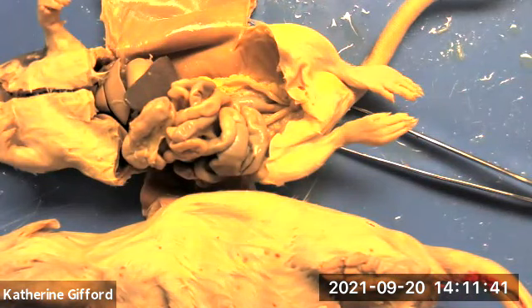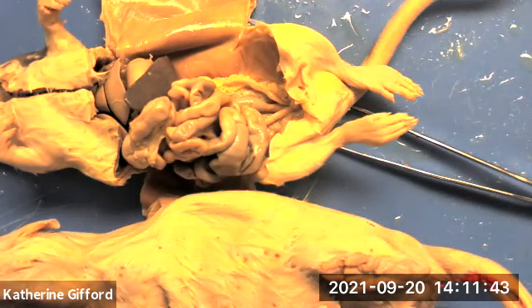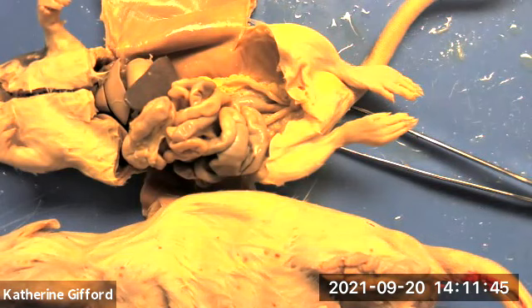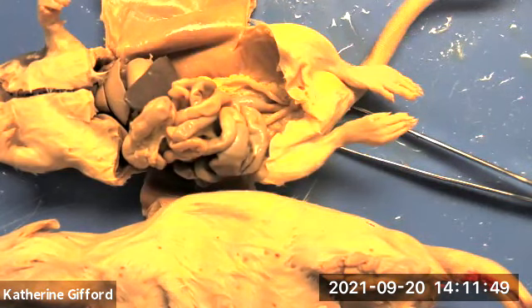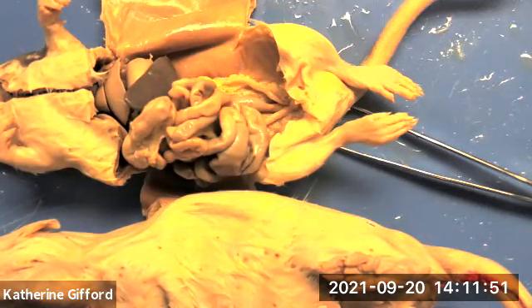And so that covers the digestive system and the two reproductive systems.